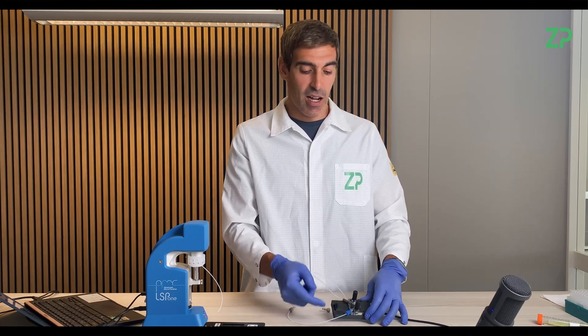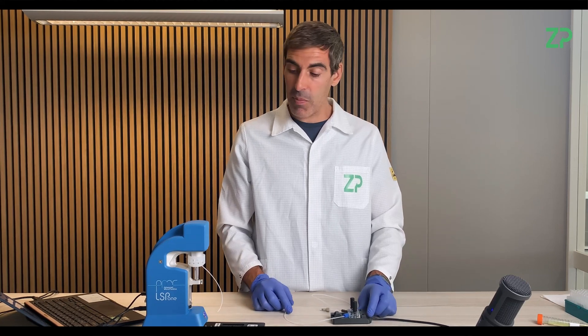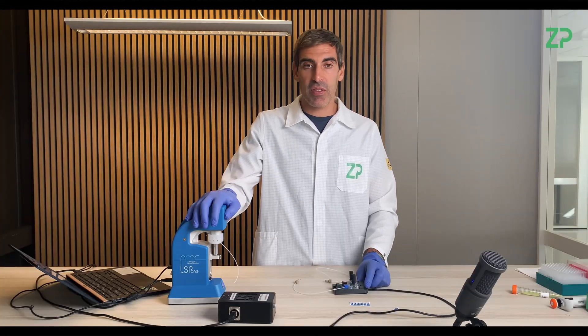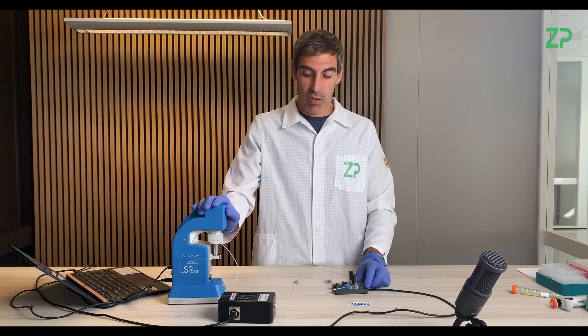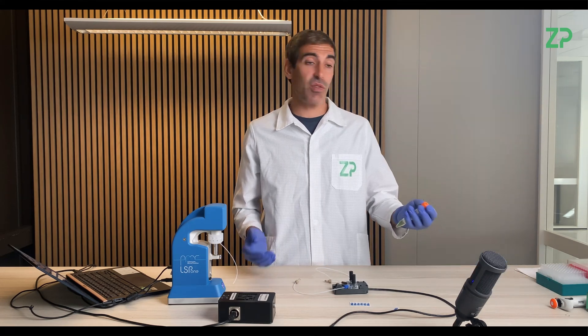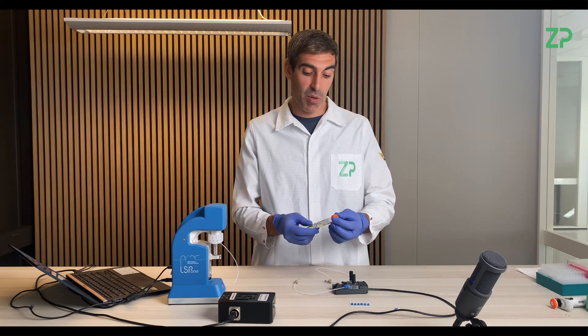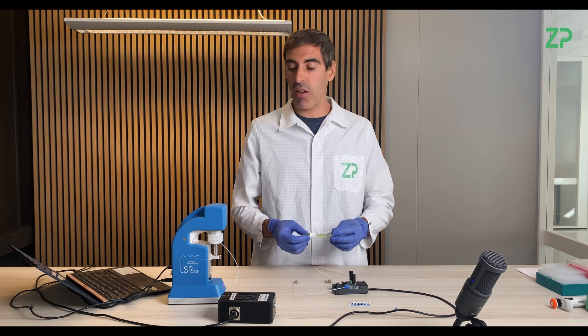And these are great. Basically what we're going to do is fit it inside our flow cell, and with the help of this LSP pump from Advanced Microfluidics, we will pump and aspirate a solution. In this case, just for the test purpose, we will aspirate a ferricyanide solution, 5 millimolar.